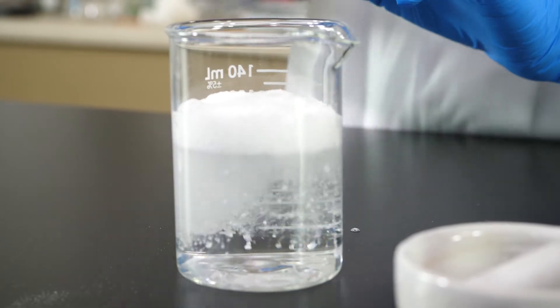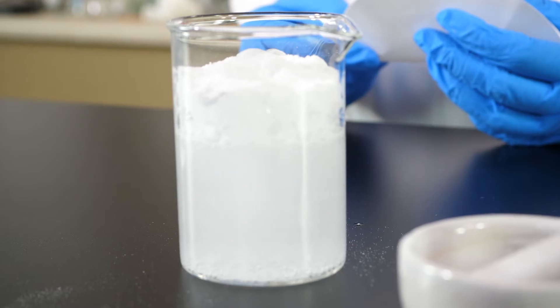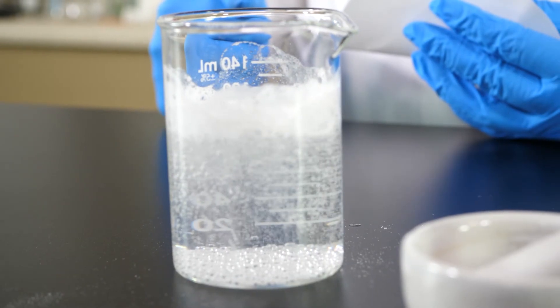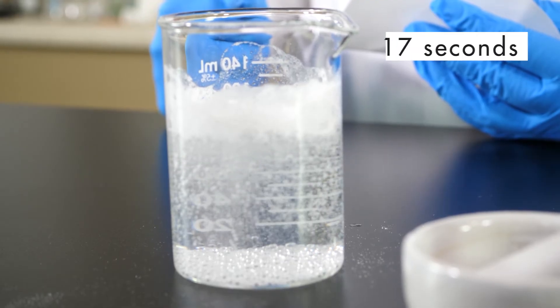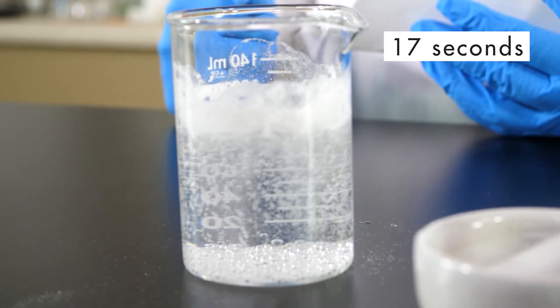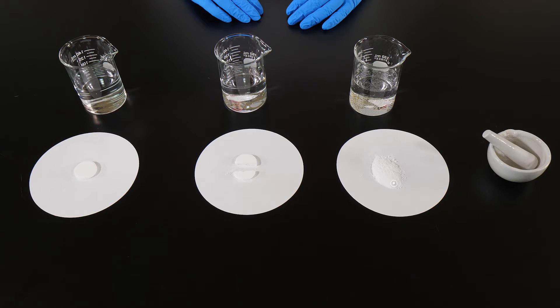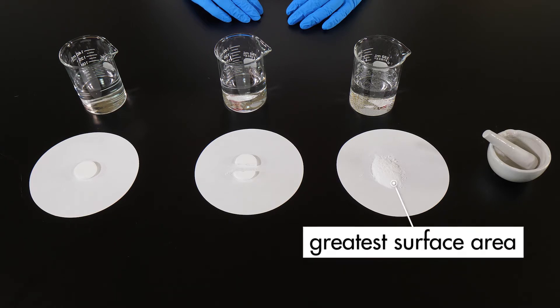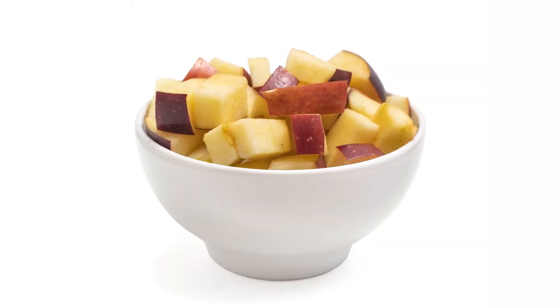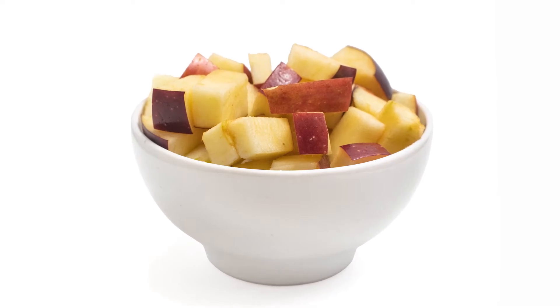We pour the powdered effervescent tablet into a beaker of warm water and time how long it takes the powder to dissolve. We see that a powdered effervescent tablet dissolves in 17 seconds, a fraction of the time required for a whole tablet to dissolve. The powdered tablet dissolved fastest because it had the greatest surface area. Likewise, food digests much faster when it is broken down into smaller pieces by mechanical digestion.